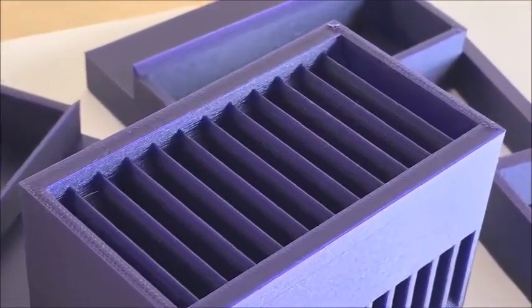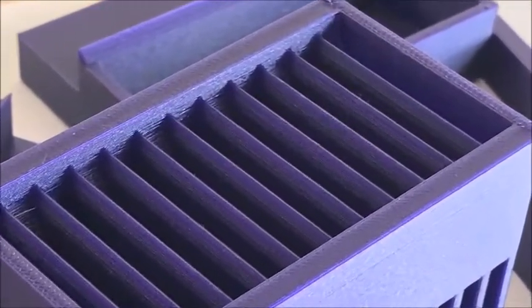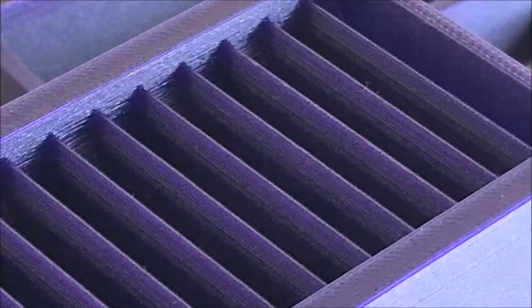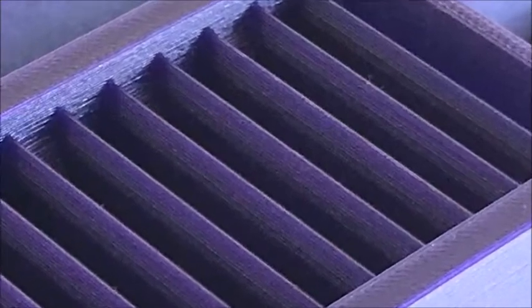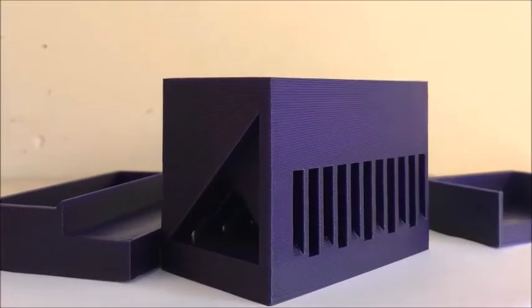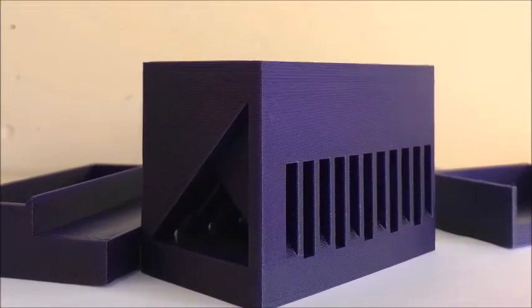The riffle splitter is a static sub-sampling device that can be used to split a batch of dry particulate matter into two half-batches.